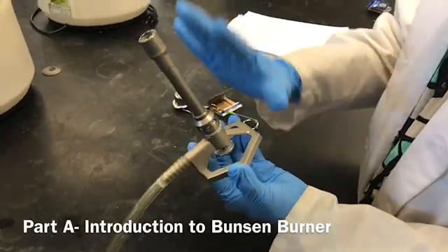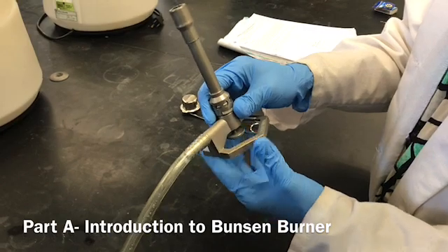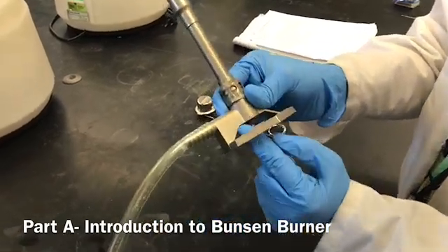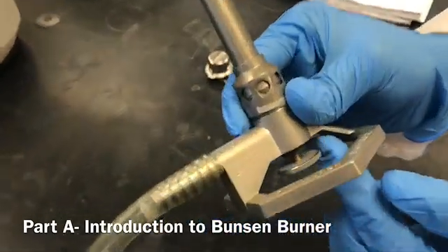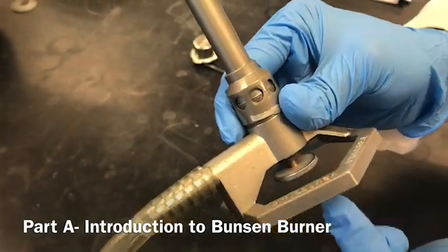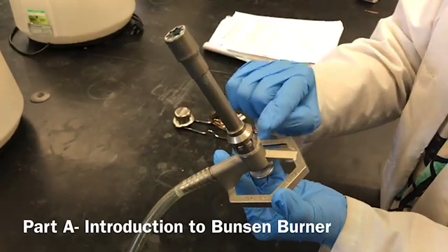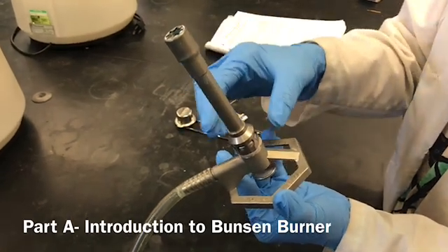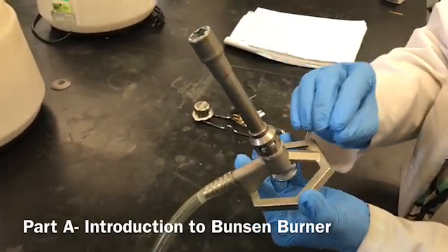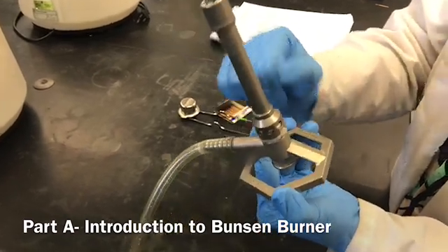Now I'm going to introduce the Bunsen burner, which is the primary heat source in the lab. The base has a gas needle valve which supplies natural gas or methane into the burner. The barrel is responsible for the supply of oxygen — so methane comes from the gas needle valve and oxygen from the barrel.